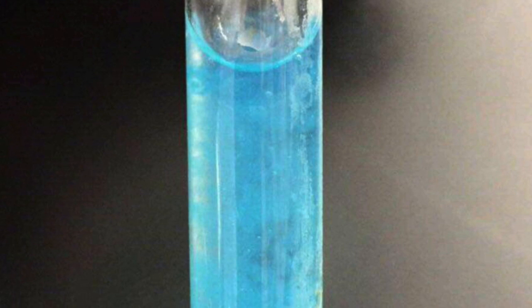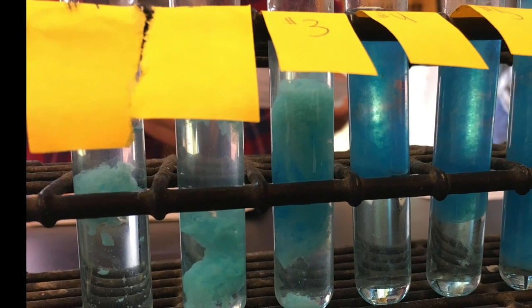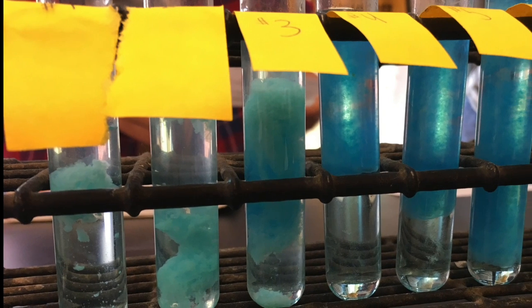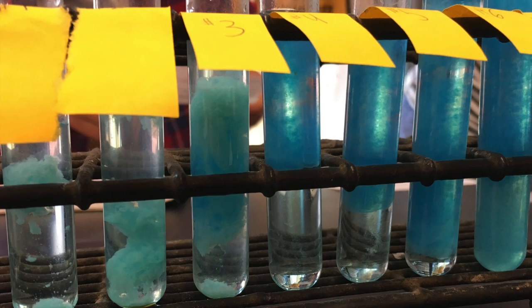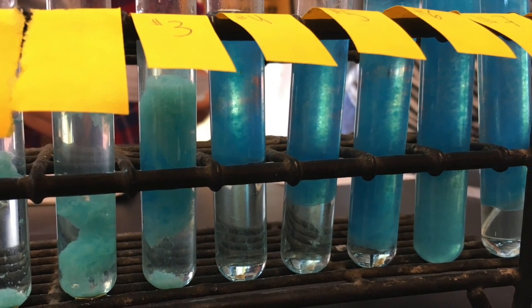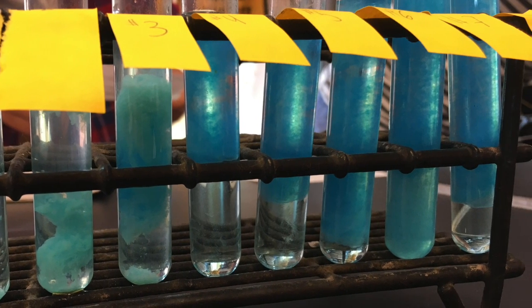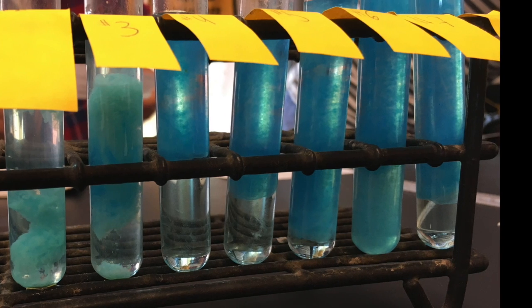The observations we had on the test tubes after stirring and during the precipitation state were that the first 5 test tubes rose steadily, while for the last 3 tubes, the measurements were the same. We also noticed that the first 5 tubes had a much different precipitation characteristic than the last 3 tubes. The first 5 tubes looked as if there was blue powder on the bottom, like Raz Apple Fun Dip, and the last 3 had a darker and more spread out characteristic to it.